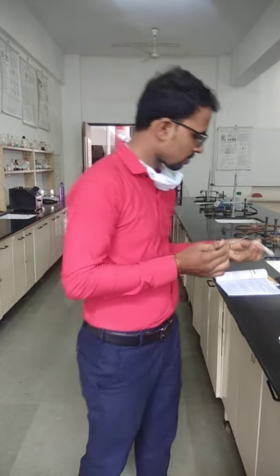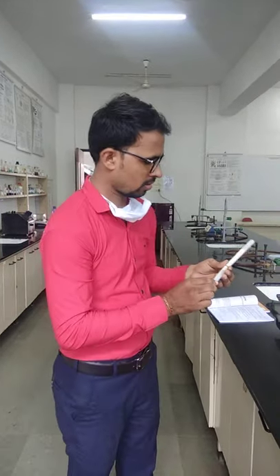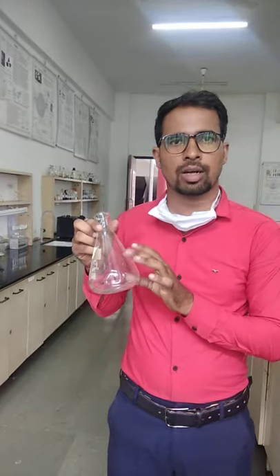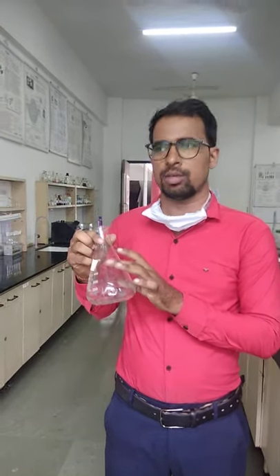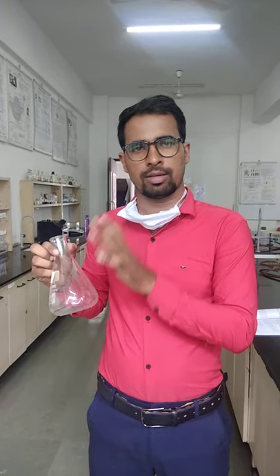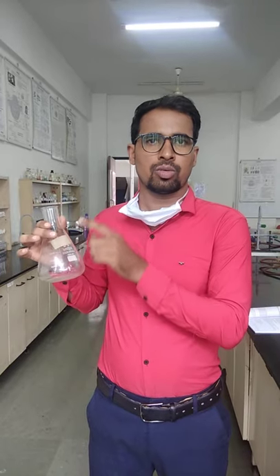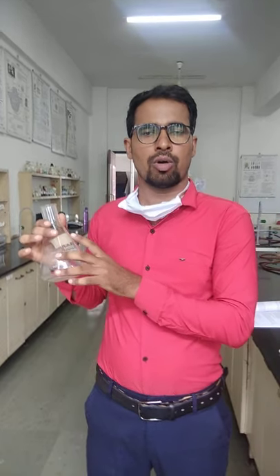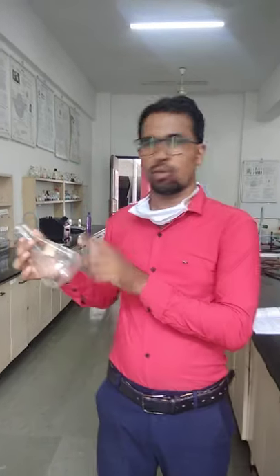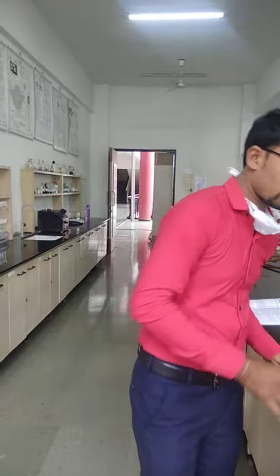After that, we have another apparatus which is the conical flask. This conical flask is also very useful for performing different microbiology practicals. Particularly, we are going to use it for the purpose of preparation of media. So everybody knows about the conical flask. Let's move on to the next.